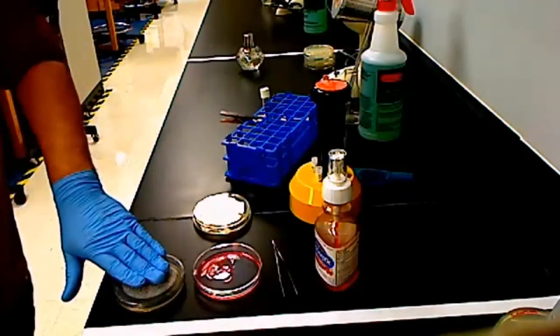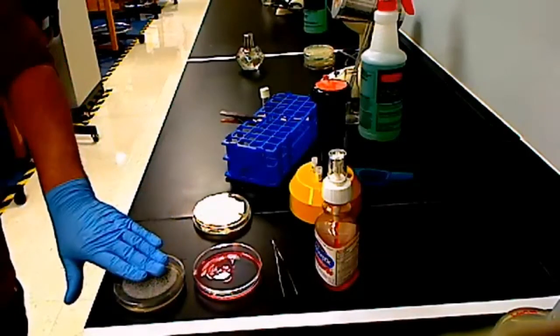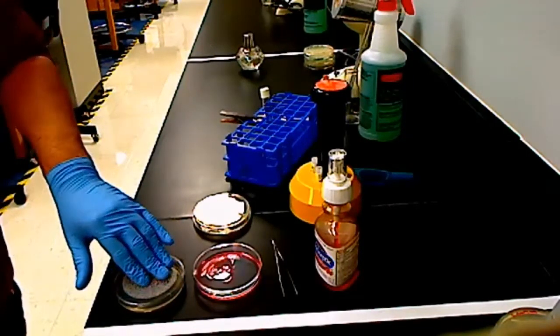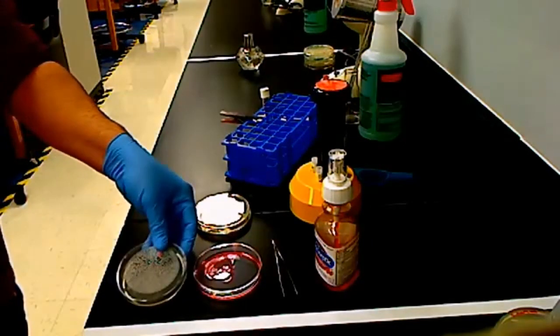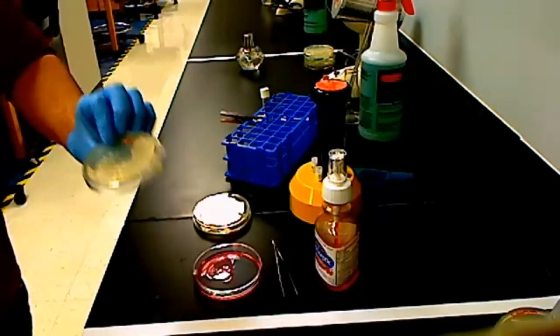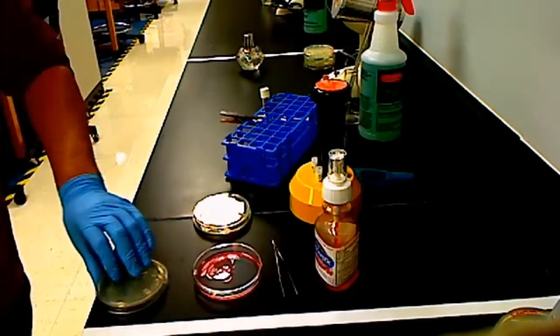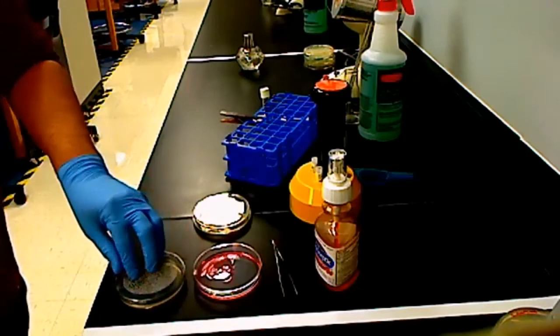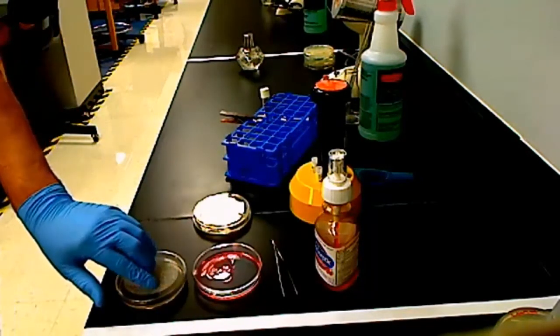And so when you're done with this plate, you will have 4 paper discs on it. You're going to put this on a pink tray, which is going to be over by the sink on the other side of the classroom. You're going to put it label side down this time. And the reason why you're going to put it label side down is because if you flip it over, these little discs have a tendency to fall down, and they'll land on the lid, and your experiment will be messed up. So keep them label side down this time. Okay? And so that's what you're going to do for the disinfectant antiseptic lab.